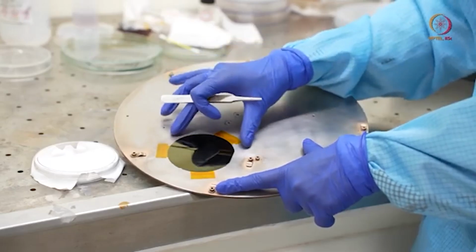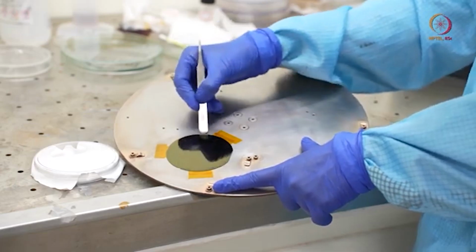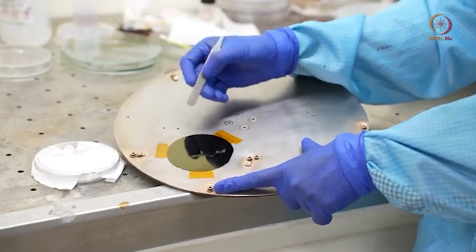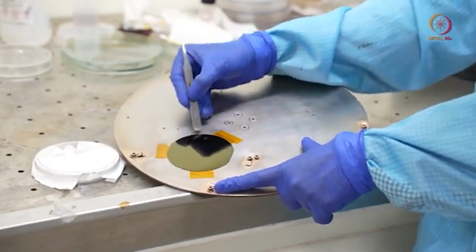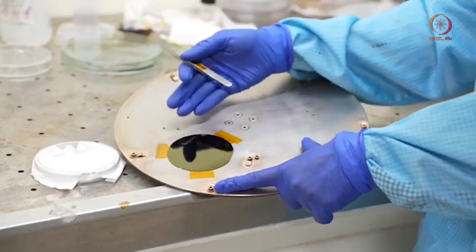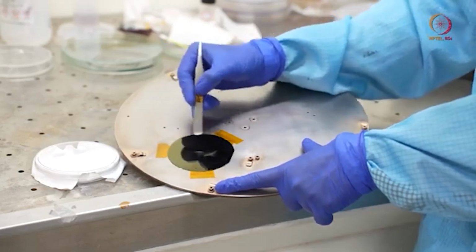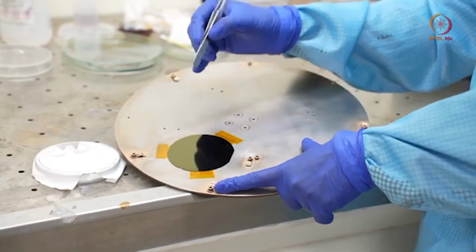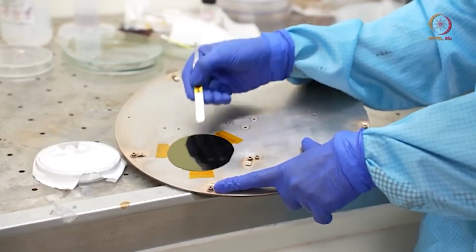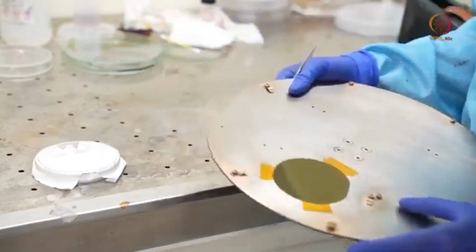Now what is the status of this sample? We can just recall the things again. The silicon wafer is the supporting material. Then the substrate is this polyimide film that we deposited, or prepared, the other day. On top of it we have done lithography. So whatever patterns you are seeing are basically photoresist patterns. There is no metal as of now. We are going now to deposit the metals. Let us load this in our chamber.